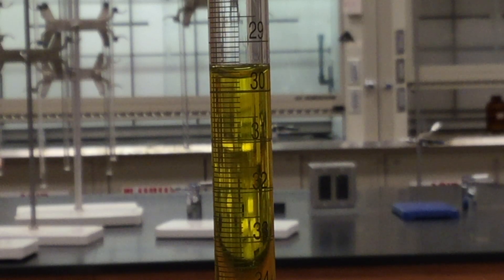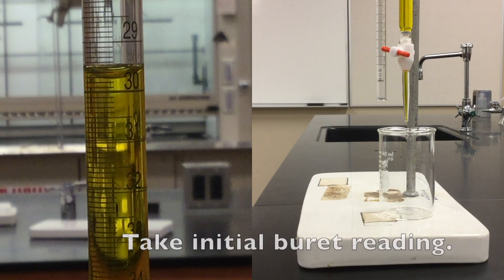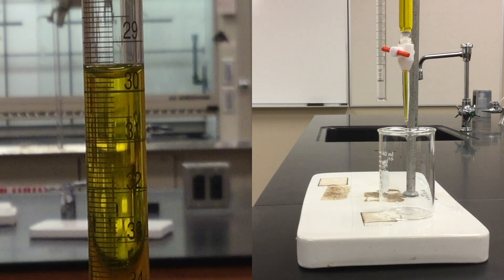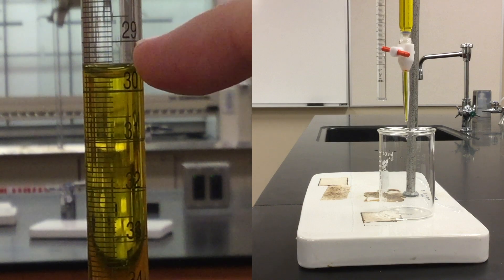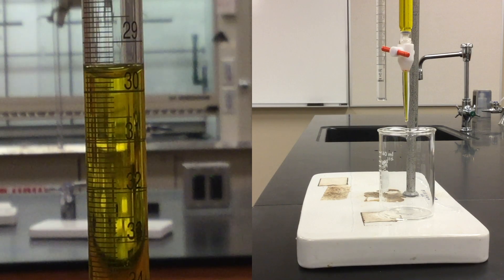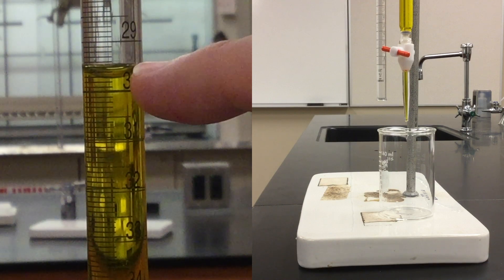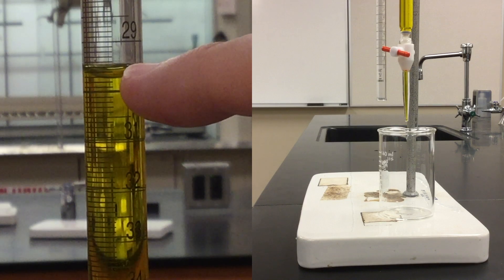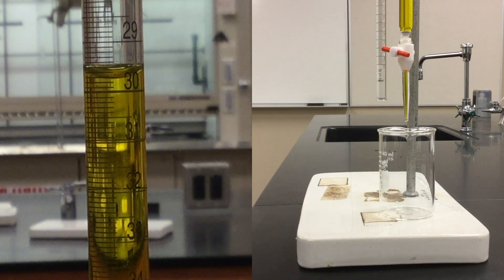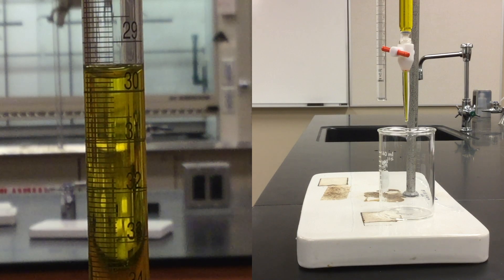Now it is time to make a volumetric measurement using our burette. First, you must make an initial reading. Let's look at the burette — what is the initial reading? Notice that Dr. Smith-Hart points to this. Right about where Dr. Smith-Hart's finger is, you will see a 29, and then there is a 30. So we know that the reading is somewhere between 29 and 30 milliliters. This device reads a little oddly, so we have to be careful. It is more than 29, but less than 30 — actually a little more than 29.5. It looks like this is 29.5, 6, 7, and even a little past 29.7. So 0.7 is the last significant digit that we can read directly from the burette.